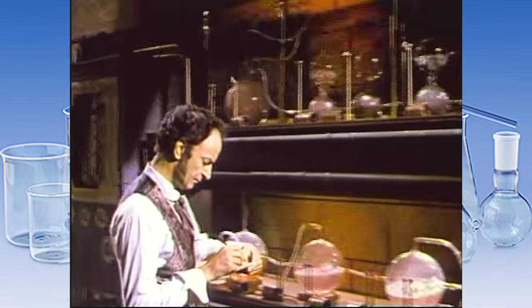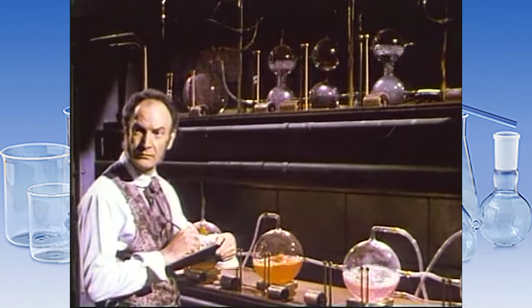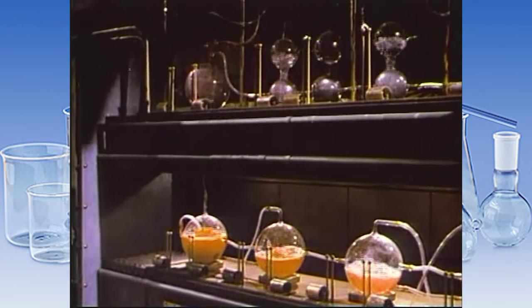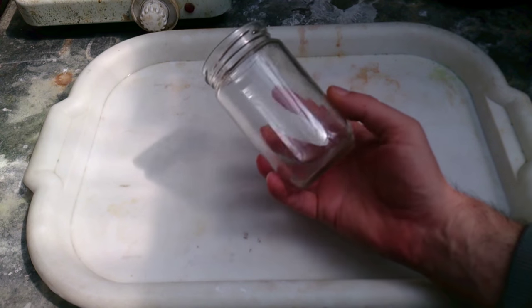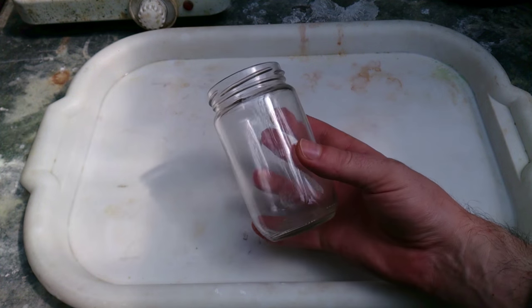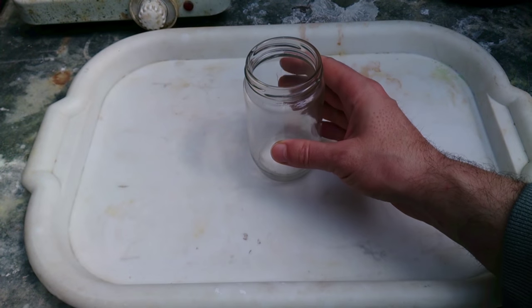And one day I came up with the idea. If I want to prove my knowledge about glassware, I have to show you something nobody has ever done before — never ever. So here we are. I will try to make a heat-resistant beaker from an ordinary glass jar, and to prove my point, I will boil water on a normal kitchen hot plate. Do you still think I stand no chance? Just watch and learn.